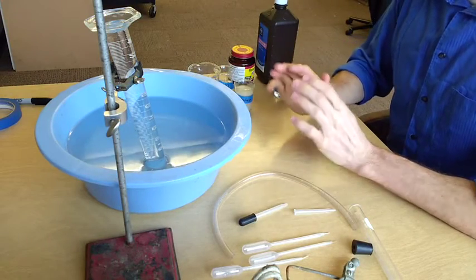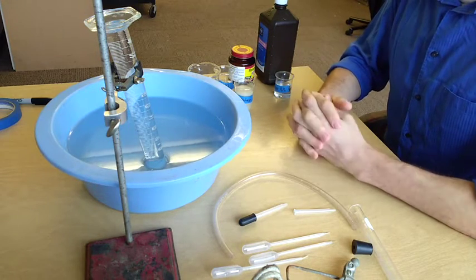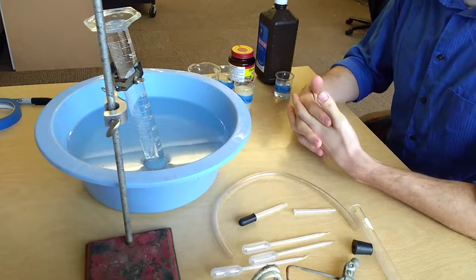Hello, I'm going to be showing you how to set up this enzyme lab and what procedures you'll need to take to make some measurements.